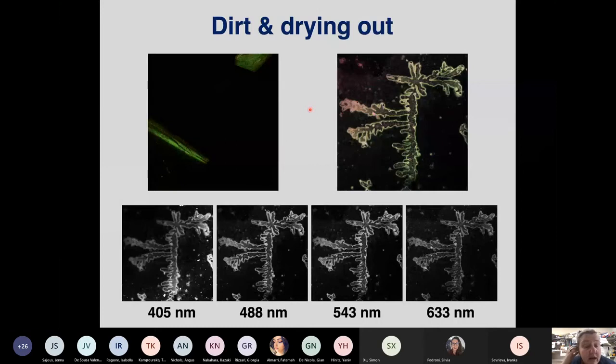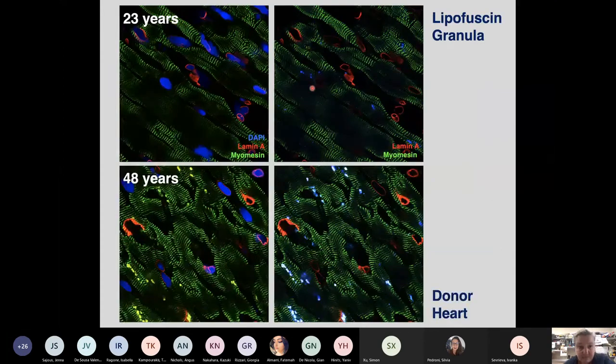Now, when you're working, you have to work fast, and you have to work in a clean fashion, because dirt is also fluorescent. And I never thought I would be able to show this, but then I had the slowest project student ever, and he managed to work so slowly that we had drying out artifacts in our samples. And so you get these interesting structures, which could be biological, but actually it's just a drying out artifact. And it's a drying out artifact that can be visualized in all four channels that we can excite in this particular microscope. So make sure that your sample doesn't dry out during the staining.